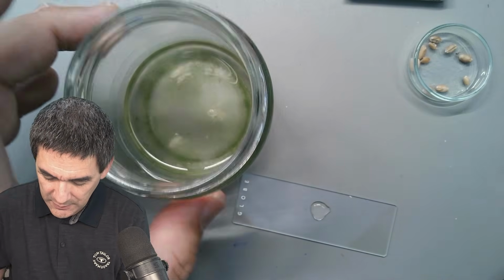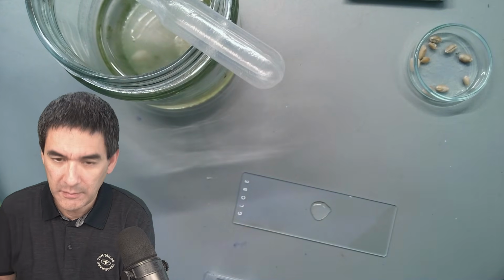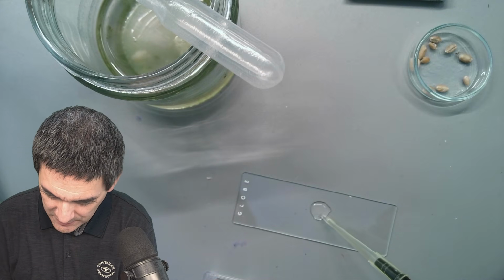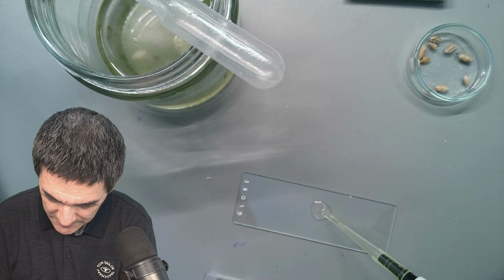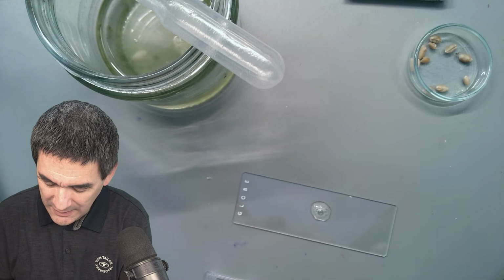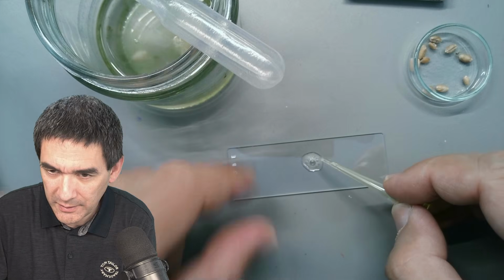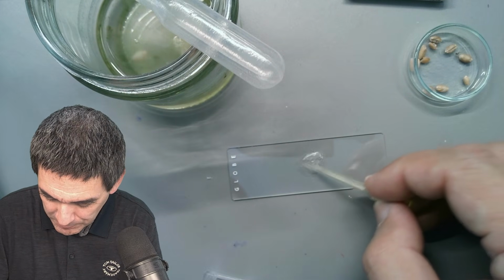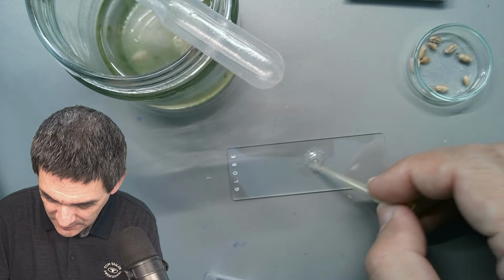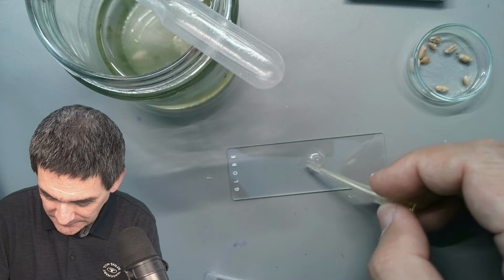And let's mix it again. You see, maybe it's easier. Yeah, I mean, sometimes you can also pull it up and down a little bit and mix it this way. But maybe not a good idea. Do you see what happens if you do that? If you pull it up and draw it up and down, you get bubbles. Yeah, don't do that. So we've got a whole bunch of bubbles as well.